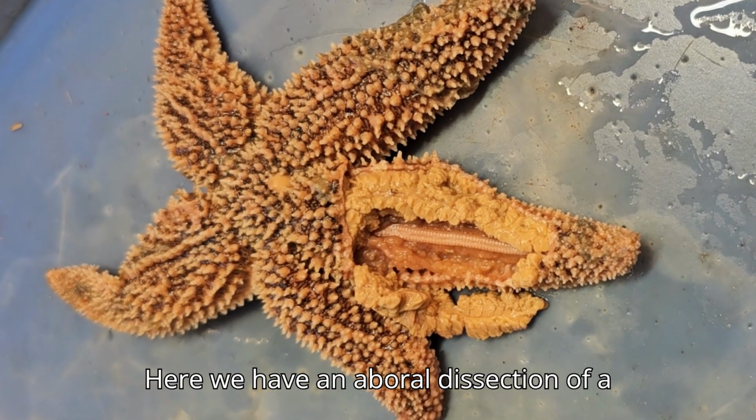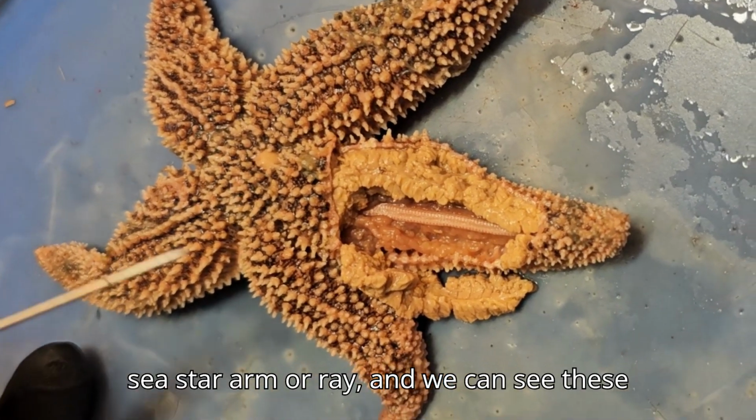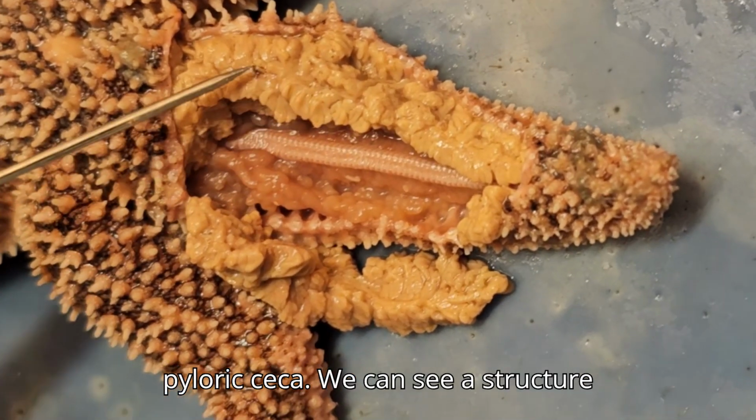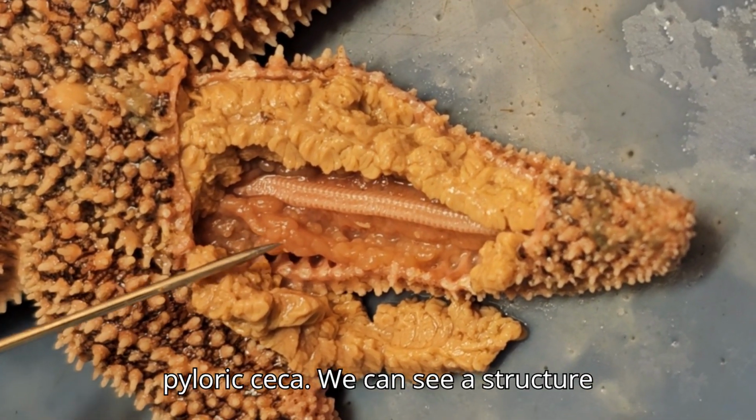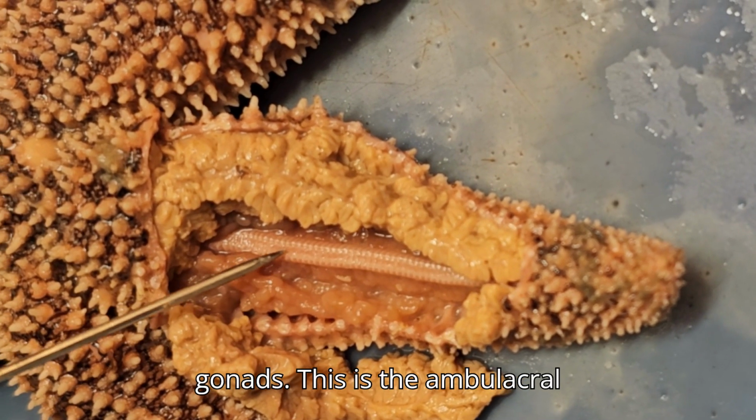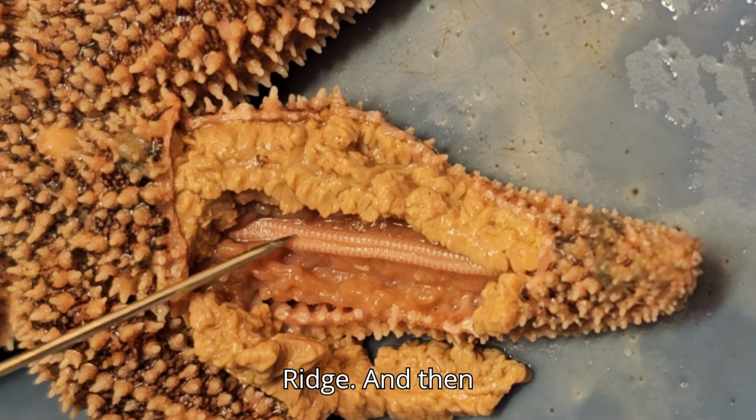Here we have an aboral dissection of a sea star arm or ray, and we can see these large structures here and here. These are pyloric ceca. We can see a structure running right along here. Those are gonads. This is the ambulacral ridge.